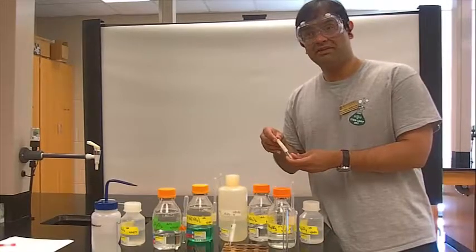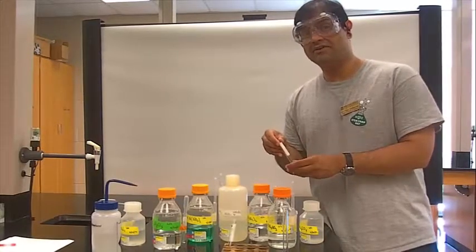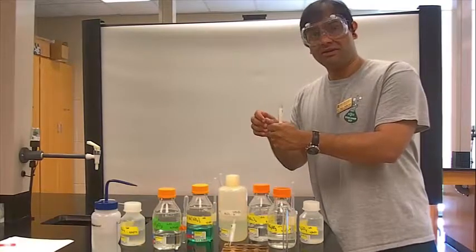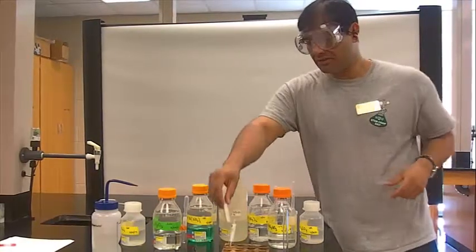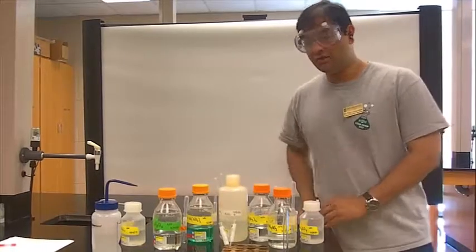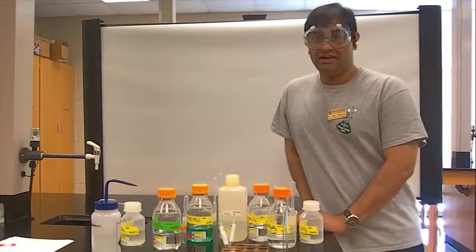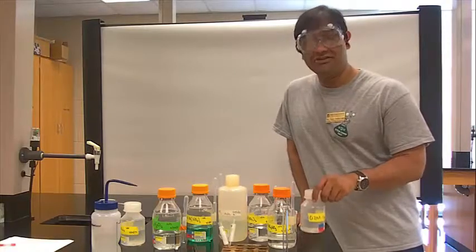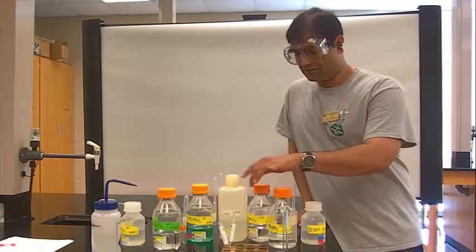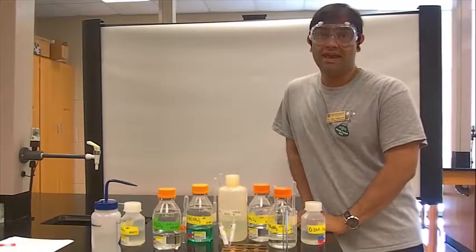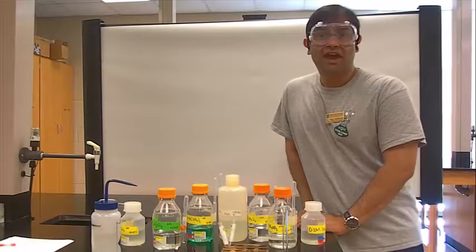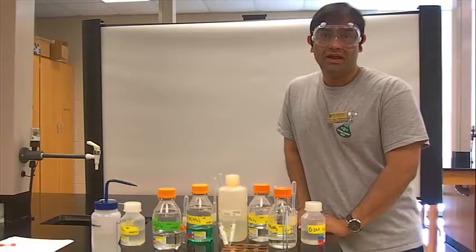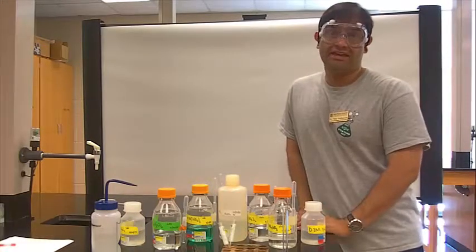If you mix an acid with a base, particularly a strong acid with a strong base, you'll actually feel the test tube becoming warm. Those are some of the qualitative aspects of reactions involving aqueous solutions. These are all solutions that are dissolved in water, so they are aqueous. We will see, when we react them according to the table, the type of products they produce.